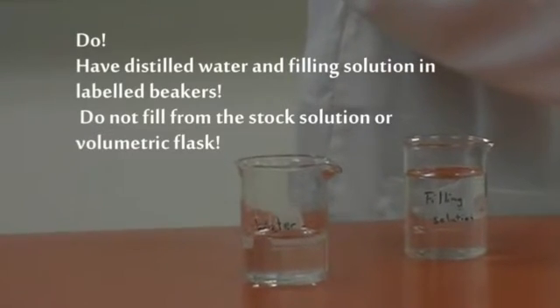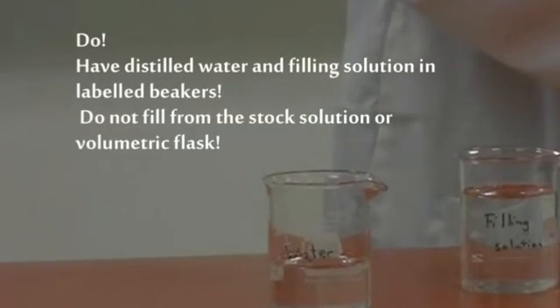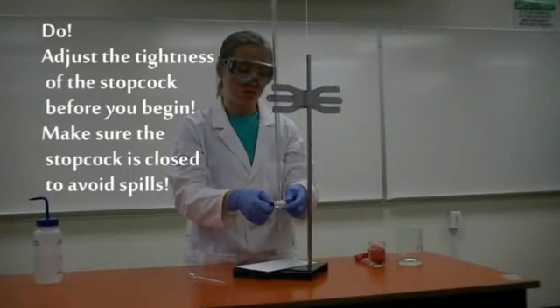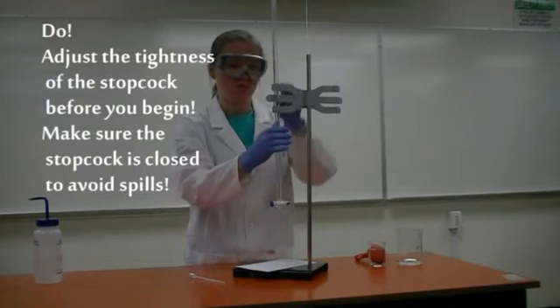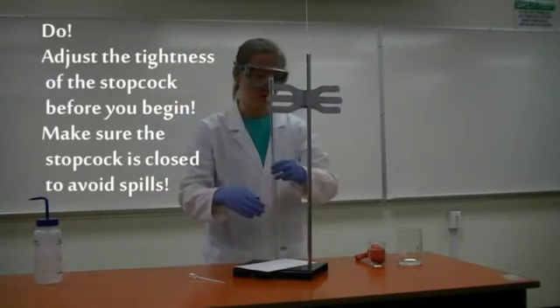Do have distilled water and filling solution in labeled beakers. Do not fill from stock solutions or directly from the volumetric flask. Adjust the tightness of the stopcock before you begin and make sure it is closed to avoid spills.